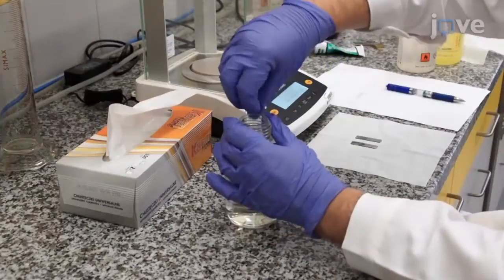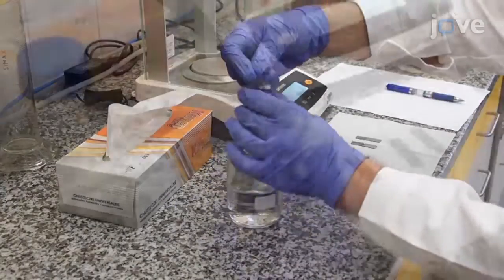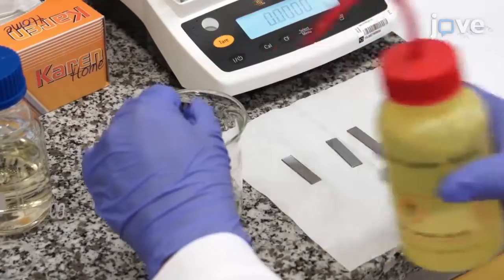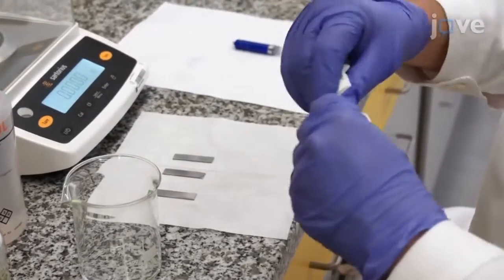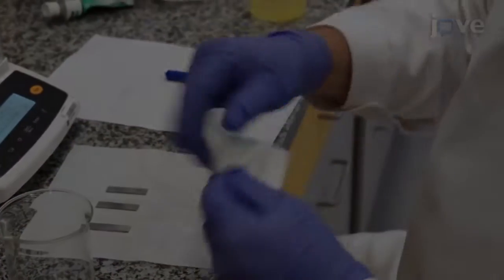Remove the metallic sample from the bottle at regular intervals for rinsing with about 25 milliliters of acetone, using pulp tissue to remove any excess corrosion products from the surface.